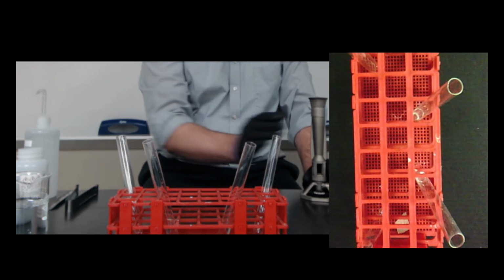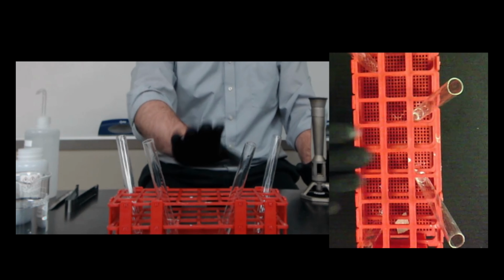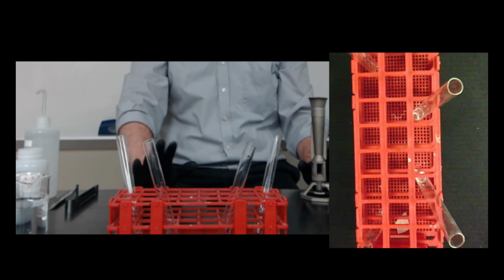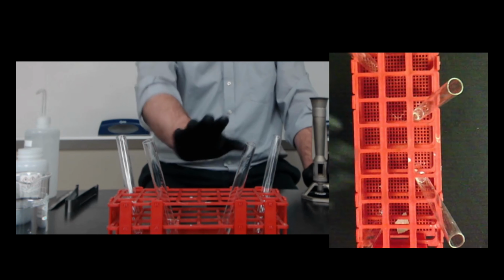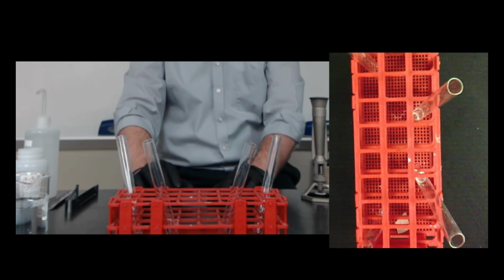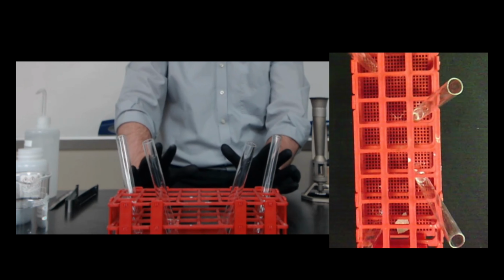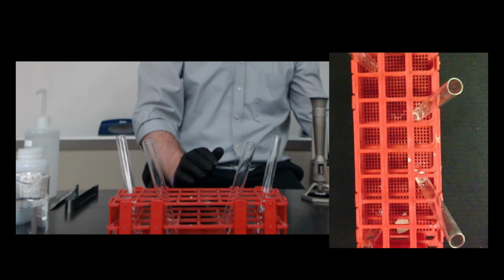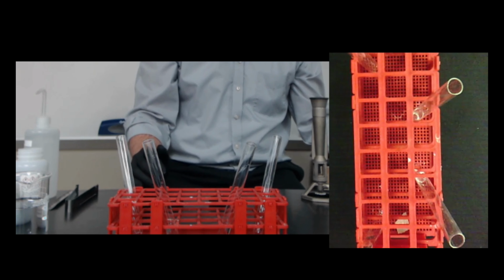The reason I have my burner here today is that we are going to produce a gas in our test tubes, and we're going to use what's called the glowing splint or flaming splint test. It's the same thing; I use those terms interchangeably. I'm going to put a flaming splint into my test tubes as I'm producing this gas. If it pops, that tells us that it's hydrogen gas. If the flame gets bigger, that tells us that it is oxygen gas. That is what we're going to use the flame test for.